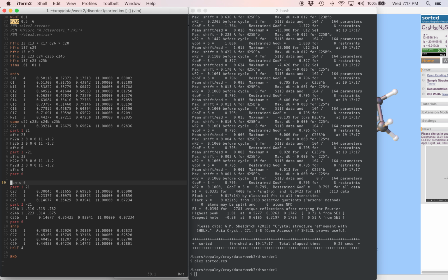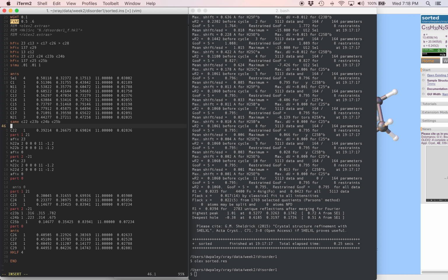At the same time, we want to make sure and restrain those anisotropic ADPs. Again, same as with the geometry, it's just that you want to keep it reasonable. You want to tell it to stay looking reasonable and not wander off and do whatever it feels like. Remember that the parameters in a disordered part are less controlled by the data, so we need to make them a little more controlled with the stuff that we tell the program.